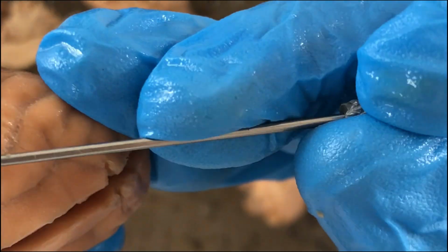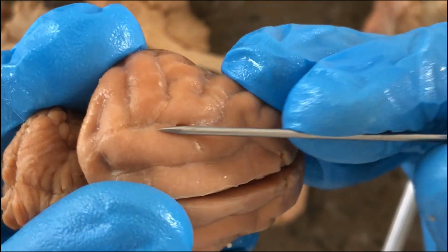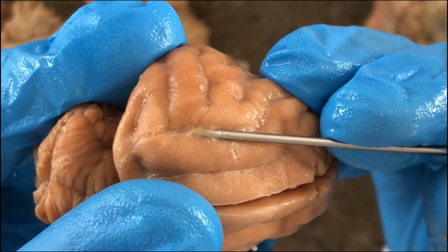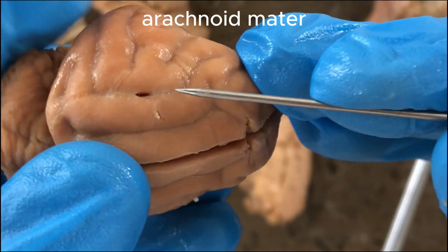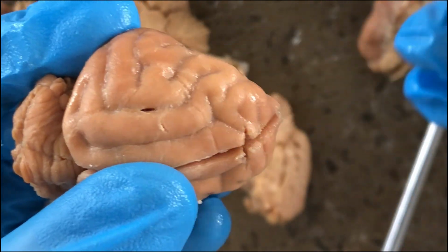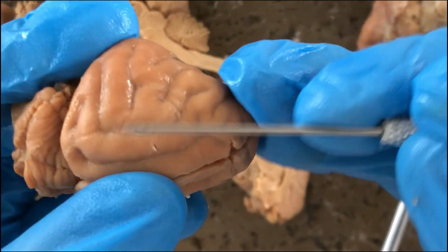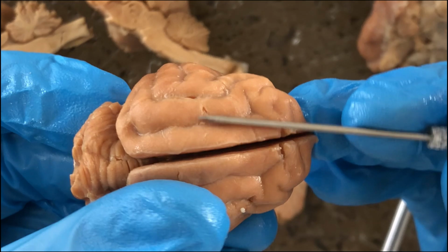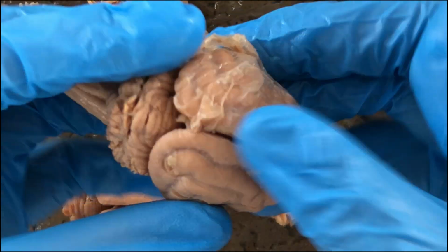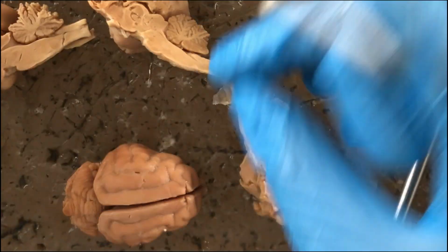But that white stuff in between these convolutions of the brain, the gyri, would be the arachnoid mater, the middle meningeal layer, and then the pia mater, the 3rd and deepest meningeal layer, would be the one that's actually close or almost fused to the brain substance itself. So it's impractical to dissociate the 2. But suffice it to know that this one, the most obvious and easily detachable layer, is the dura mater.